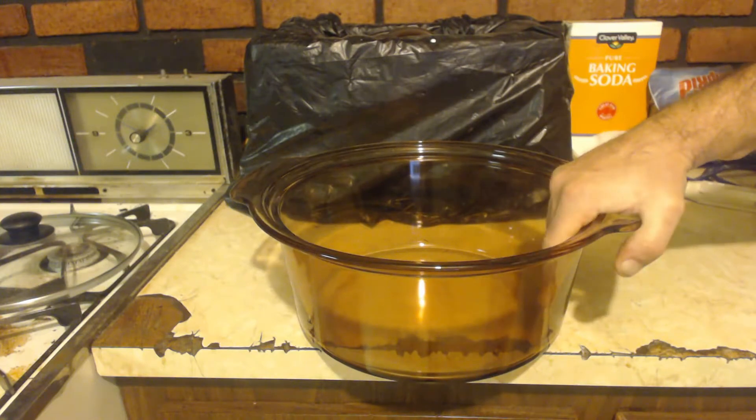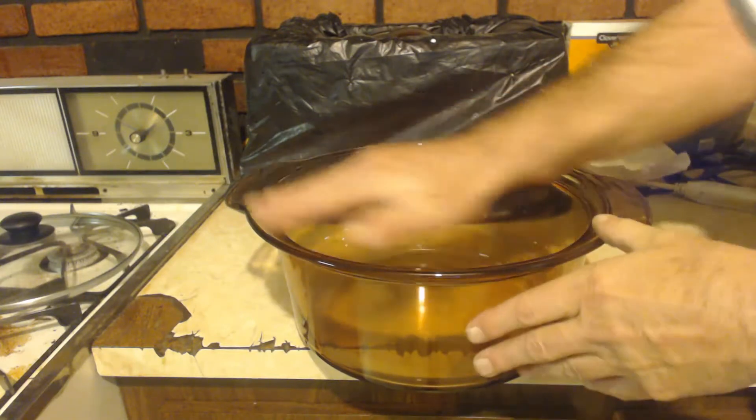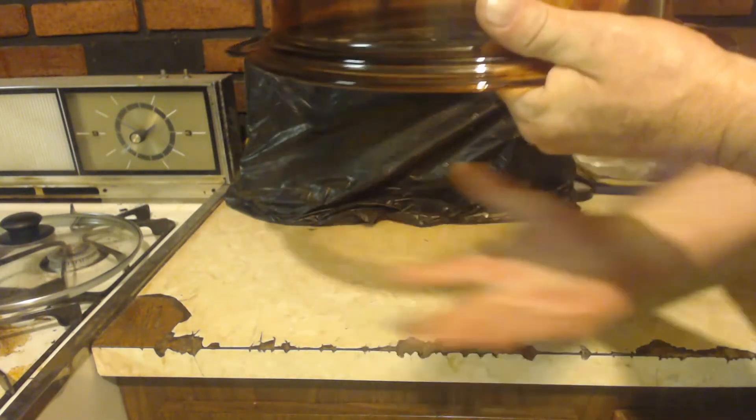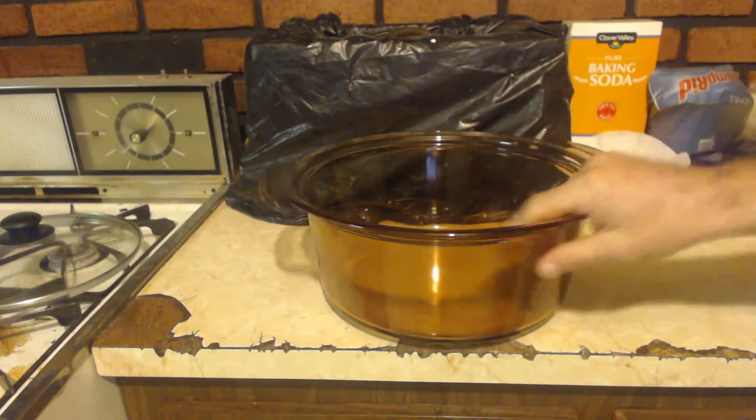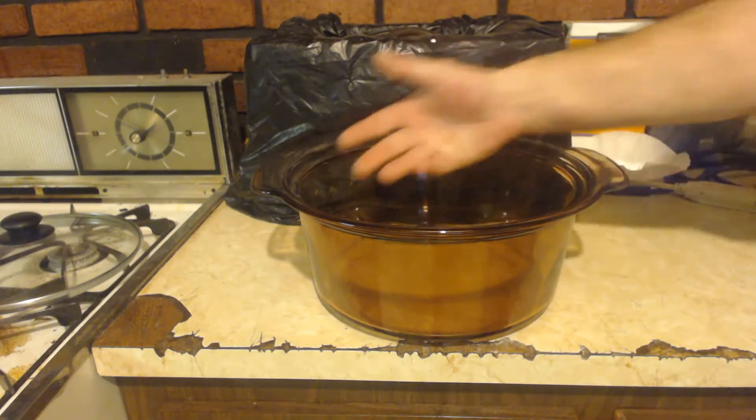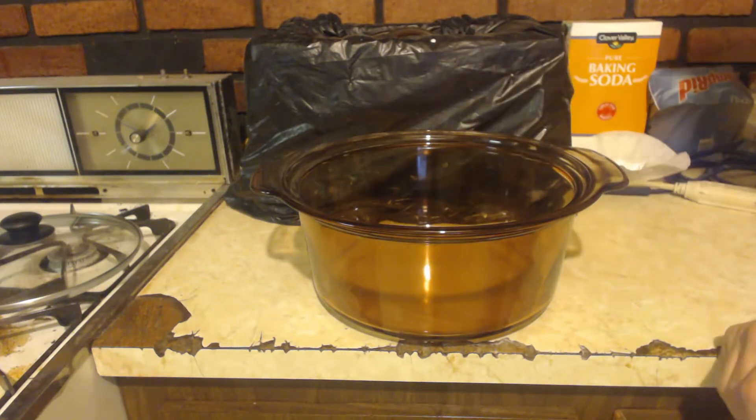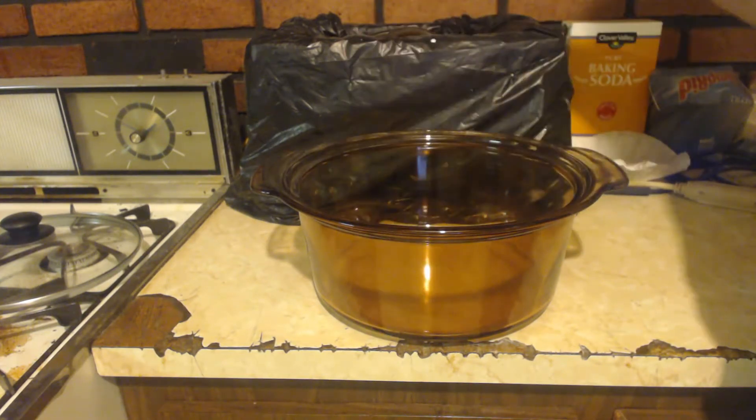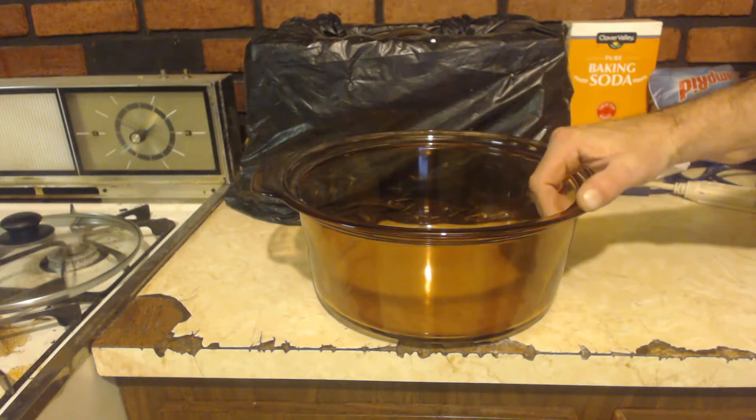I don't have a thing called a desiccator. It's basically like this glass pot only it has a gasket and another part that goes on top so you have an enclosure, with a little tube coming out so you can put a vacuum on it. You would put the calcium chloride in here and something else in here that sucks up water, then put the vacuum on it to suck the water off.